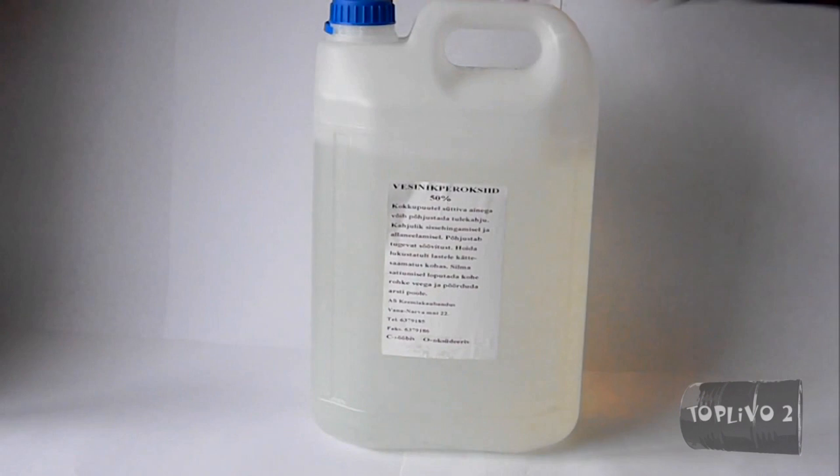Hello everyone! Today we'll consider the decomposition of hydrogen peroxide in the presence of catalysts. I recently bought a full canister of 50% hydrogen peroxide and I think I will not have problems with that.